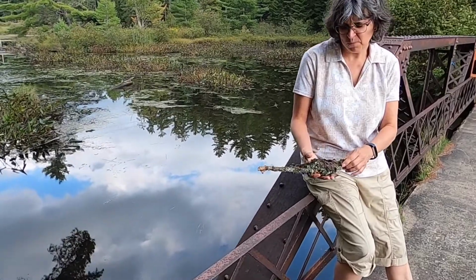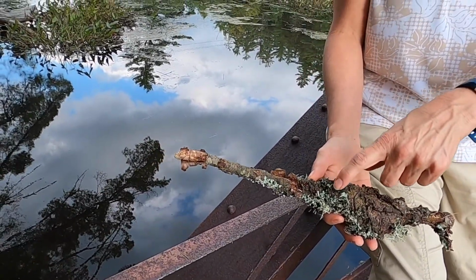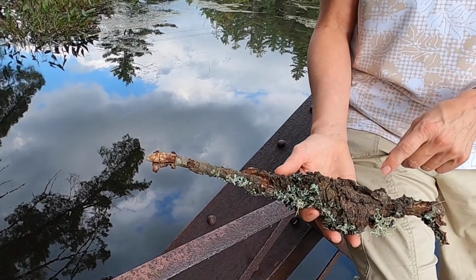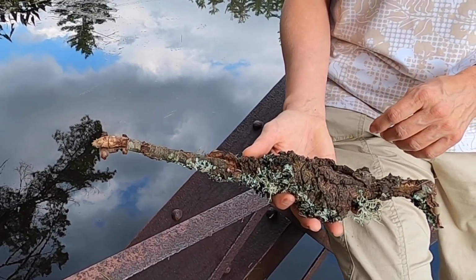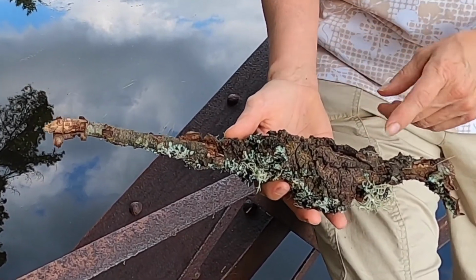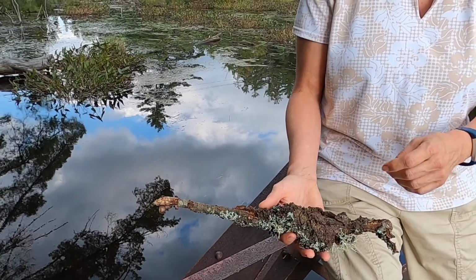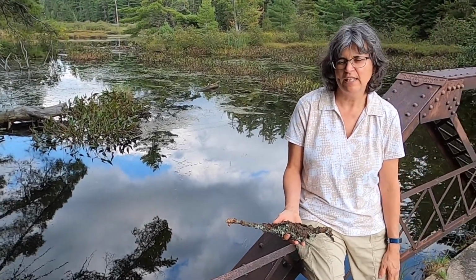This is an older specimen, and what I'm looking at is this woody growth here. If this were a fresh specimen, it would be completely black. It would look like some sticky tar on there. And the photograph that's on page 9 in your lab handout looks like that. But this one is an older one, but it does help you see how fungi can sometimes actually look very woody. They don't have to always look like a mushroom or a shelf fungus.